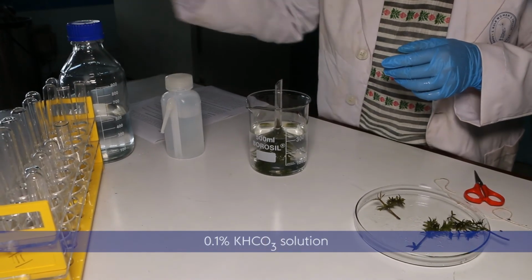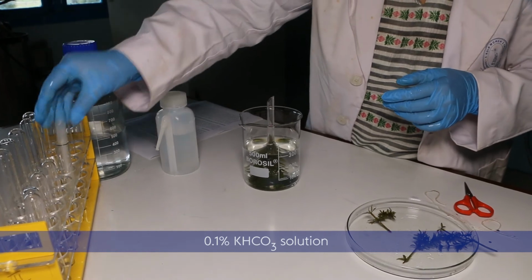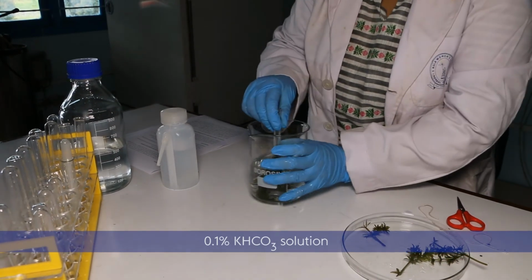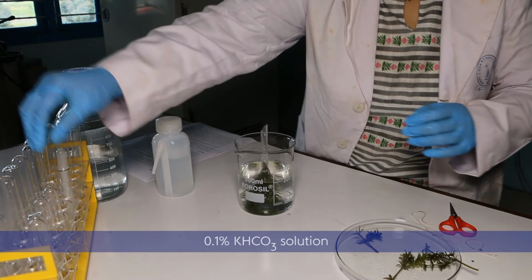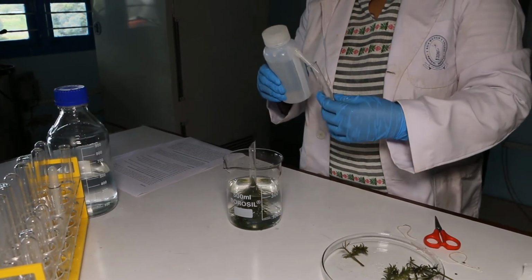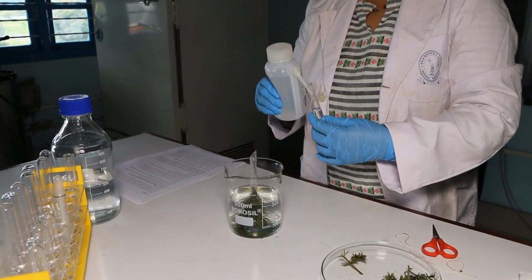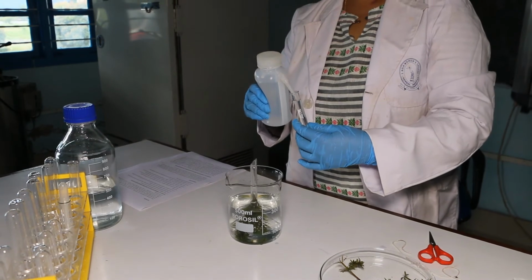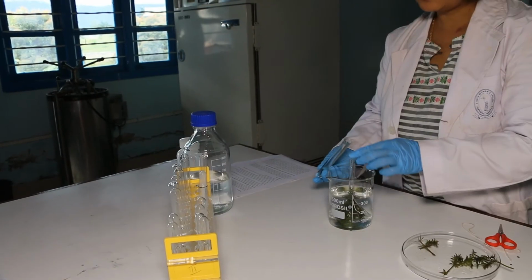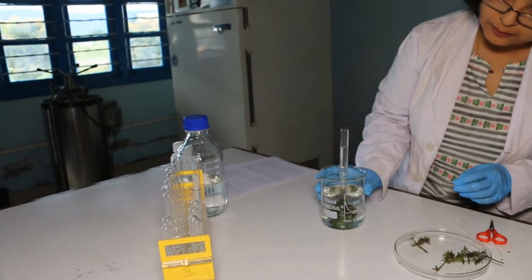Now add a few ml of 0.1% potassium bicarbonate solution. This serves as dissolved carbon dioxide source for the plants. Next, invert a test tube filled with water over the neck of the funnel so that the jet of the funnel remains inside the tube in vertical position.